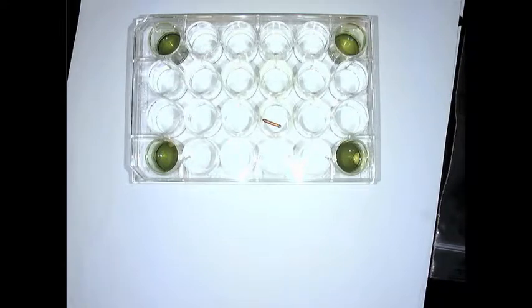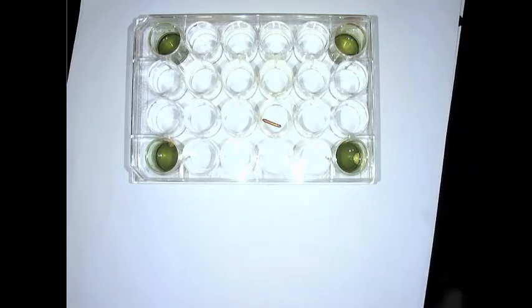with a green universal indicator. And that indicator changes color based on how acidic the air and the solutions that it's exposed to are. In the other wells we have just distilled water, and in one of the center wells you will see a small piece of copper wire. So we do have some statues and buildings that contain copper, so you're actually going to see what can happen to copper in nature. So what we're going to do is place the well plate in a plastic bag, and that's going to allow us to trap the air so that the reaction can occur.